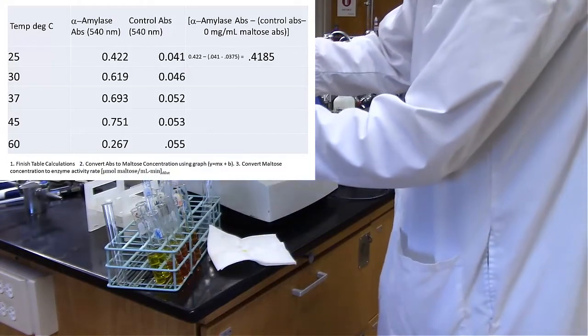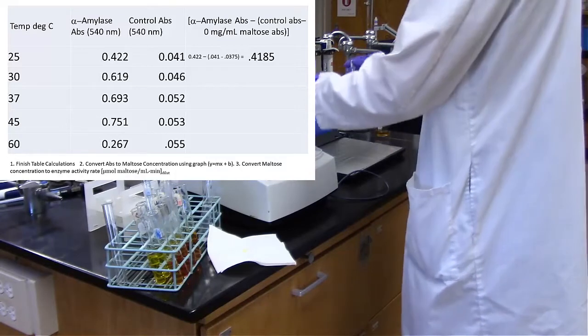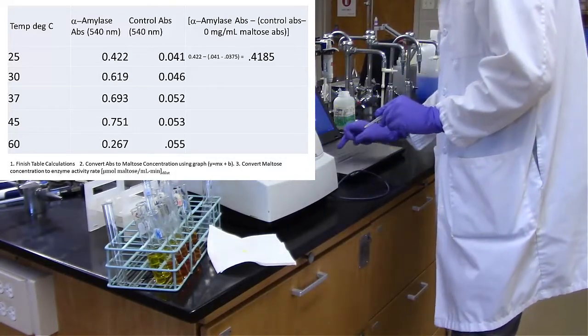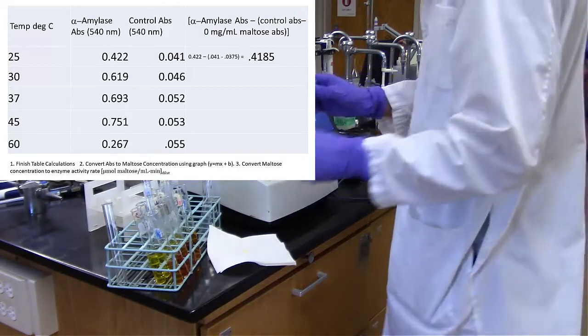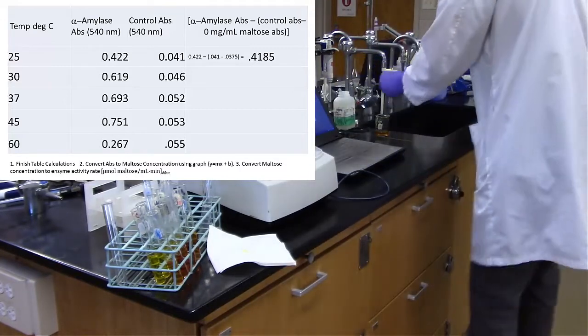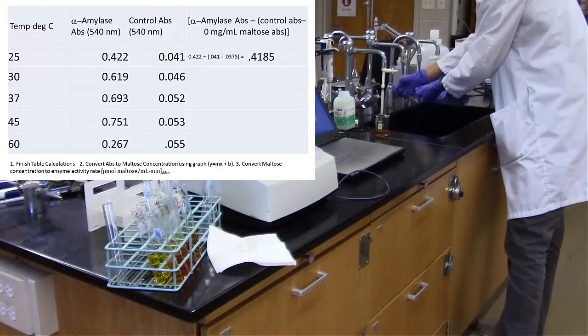Alright, at this point, you're welcome to continue to watch me fill the cuvette and run each sample as well as the control, but here is the data from the experiment. So for the room temperature experiments, it looks like we do have some alpha-amylase absorbance. It's not quite as high though. It looks like it actually keeps increasing up to 45 degrees.